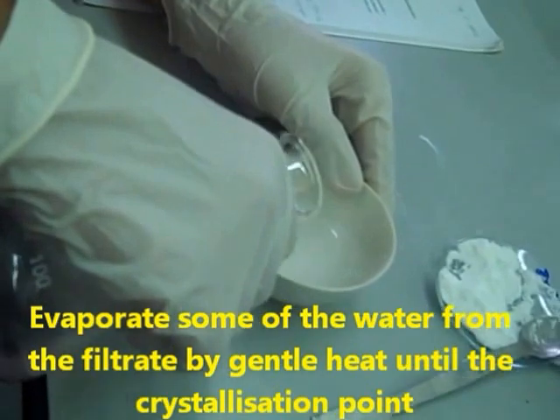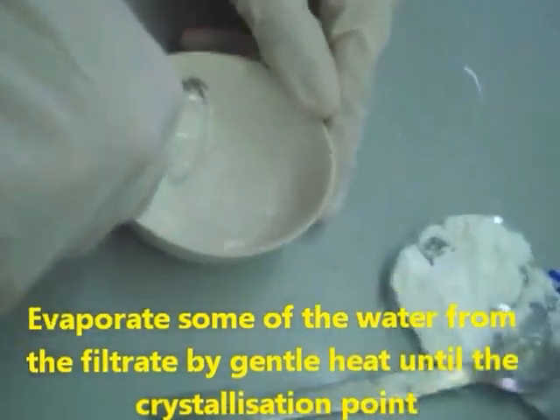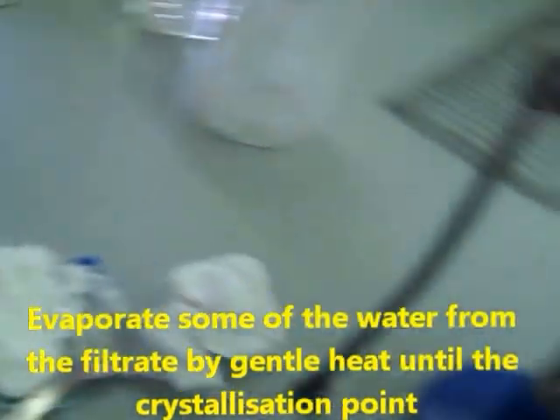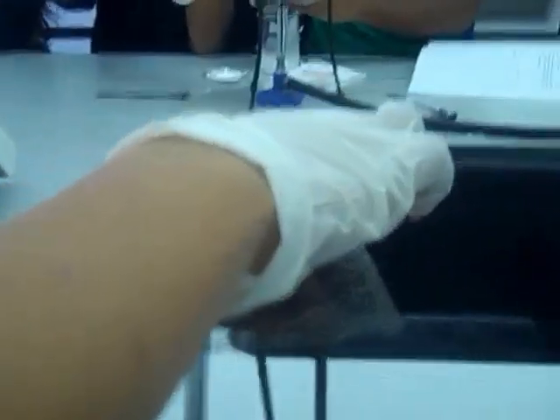I'm going to heat the solution with zinc chloride. We keep it in the evaporating dish and wait for the solution to be saturated.